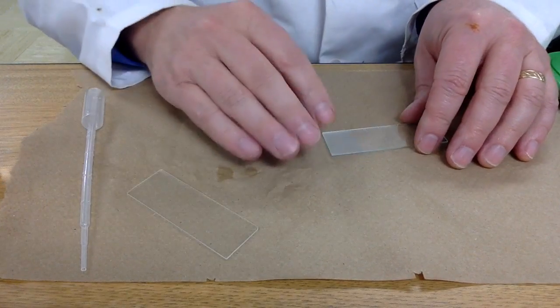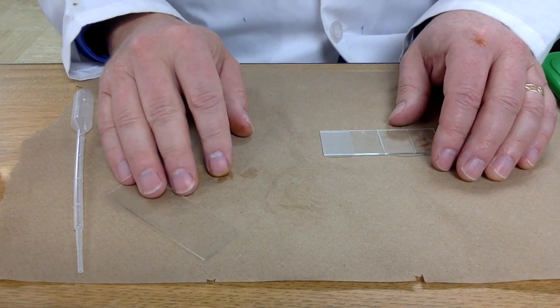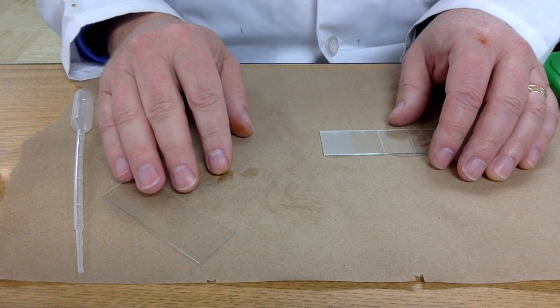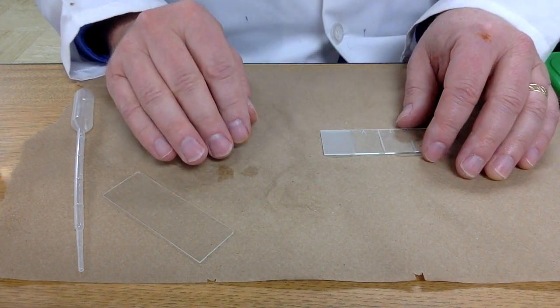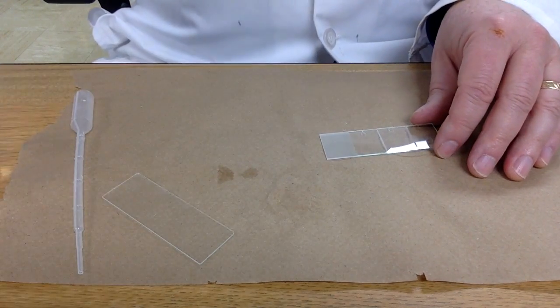Today we'll be learning some things about how to make and prepare slides for your observation under the microscope. First, there's no mystery to cleaning the slides.